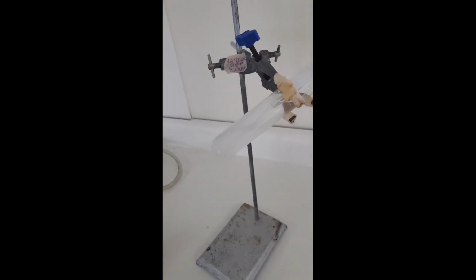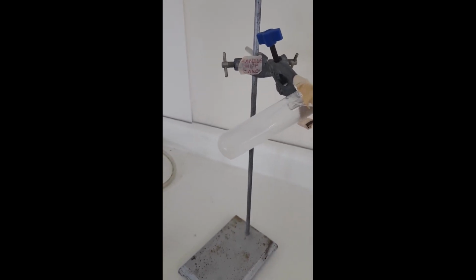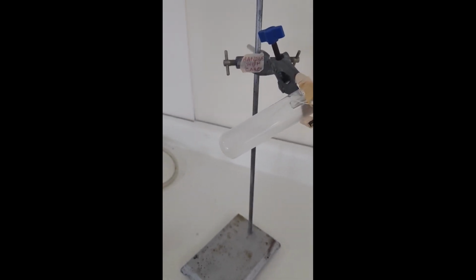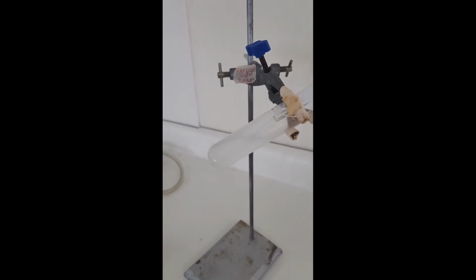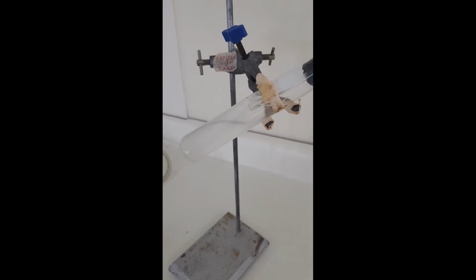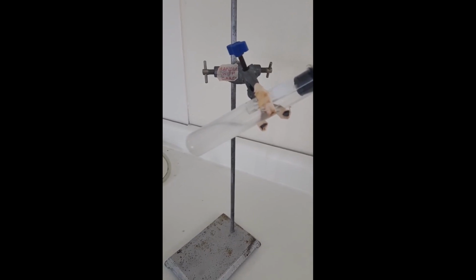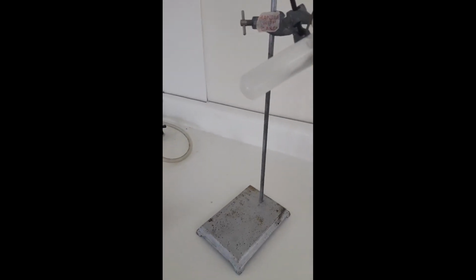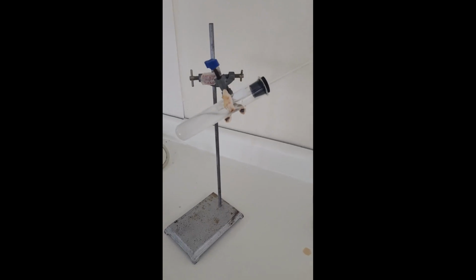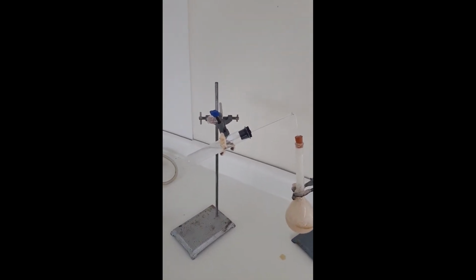And if we look carefully here, you can clearly see what has happened in our lime water, right? And it's up to you to tell me if you think we got that white precipitate we mentioned at the start. Right, so this is towards the end, so effervescence would have slowed down by now. Right, so that's the end of this experiment. So you all can decide whether or not yeast respires anaerobically to produce carbon dioxide.